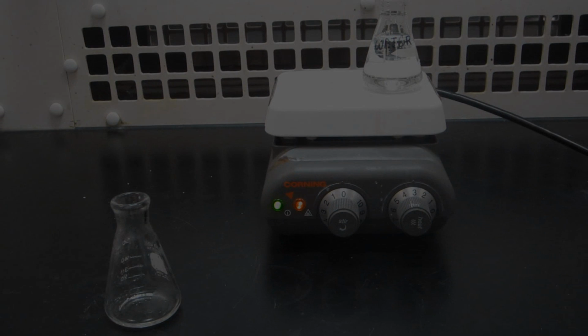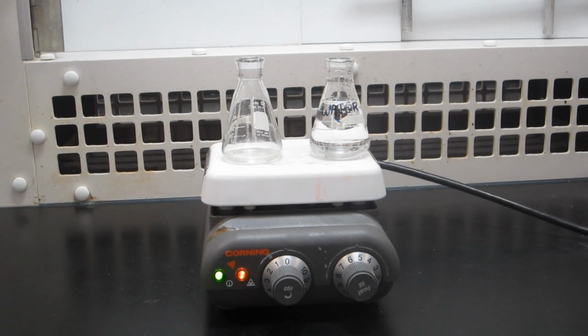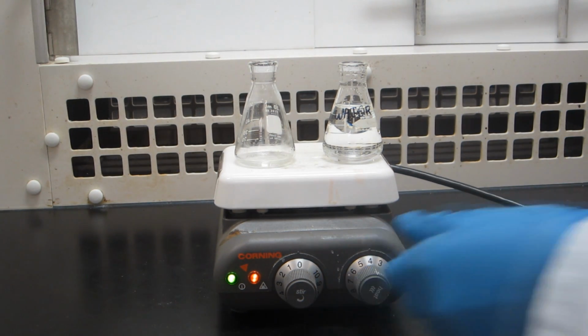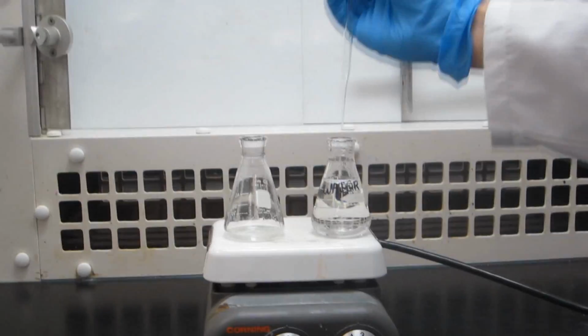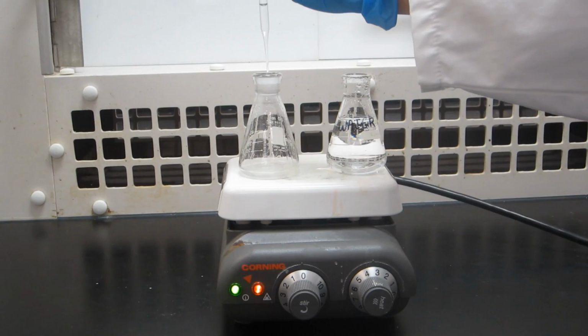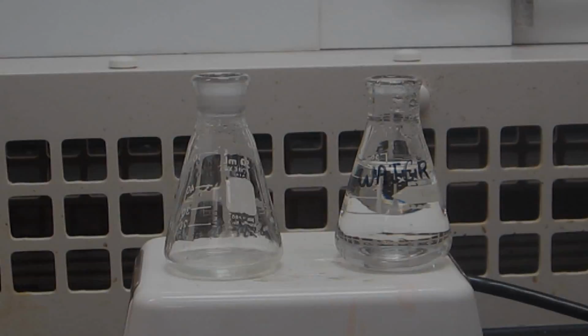Note that if there are insoluble impurities, do not add excess solvent to dissolve them. Most recrystallizations only require one solvent. In this case, the flask containing the desired solvent and the sample flask should be heated simultaneously on a hot plate. Then, the minimum amount of hot solvent should be added to fully dissolve the sample.